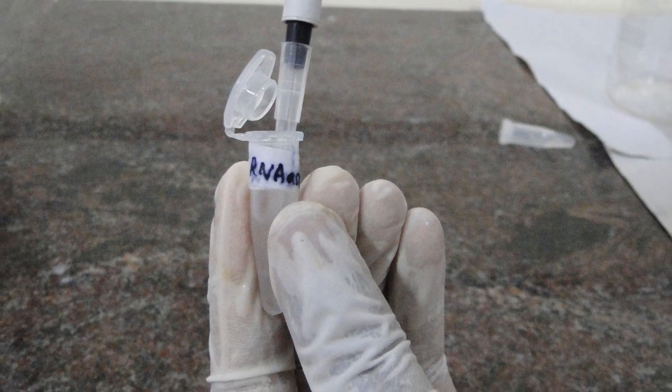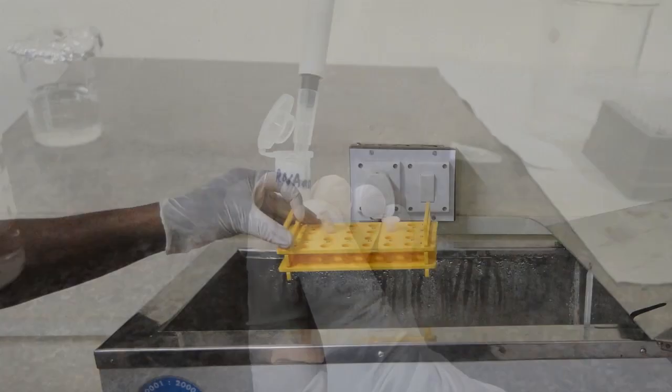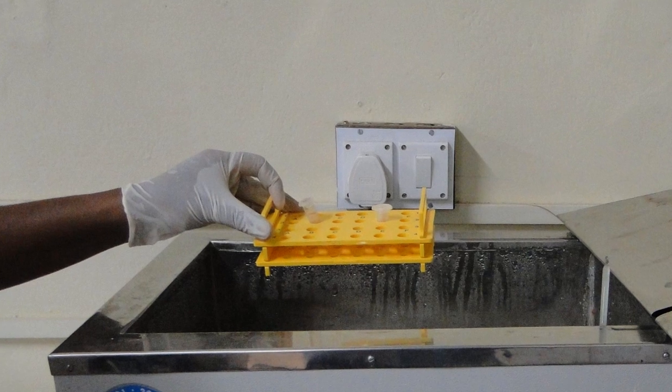Add 2 microliters of RNase to the same vial containing DNA. Incubate the vial in water bath for 2 hours at about 37 degrees Celsius.